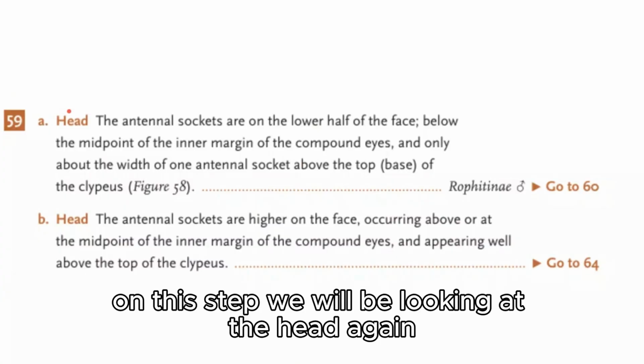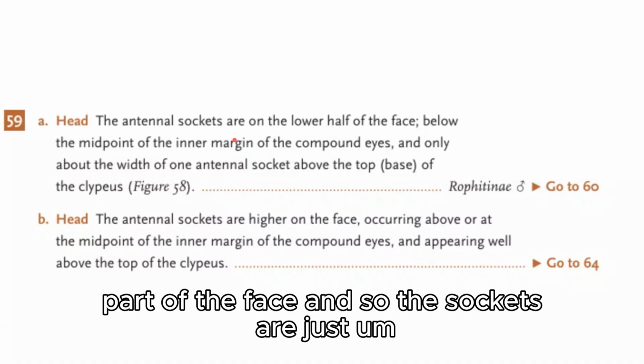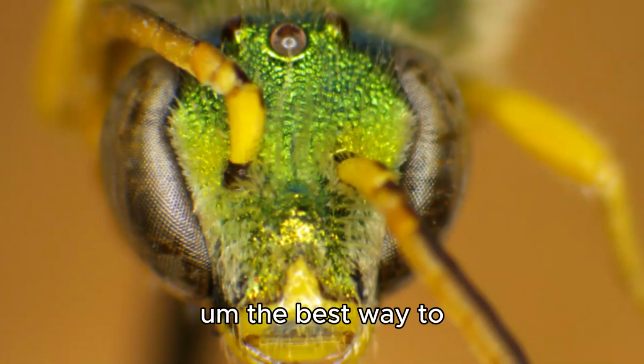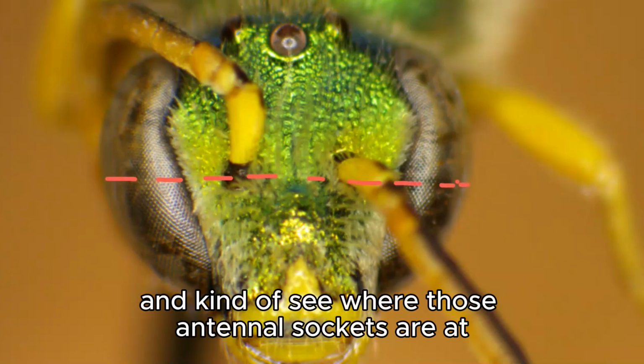On this step, we will be looking at the head again, and so we are gonna be looking at the antennal sockets, and we're gonna see if they're on the lower half of the face or on the mid to higher part of the face. And so these sockets are just, the antennal sockets are where the antenna just connects to the face. You can see right here. The best way to kind of go through this step is kind of draw an imaginary line in your head and kind of see where those antennal sockets are at.